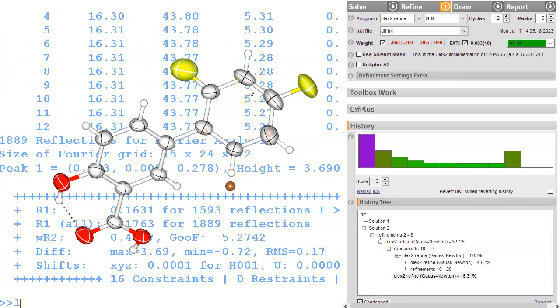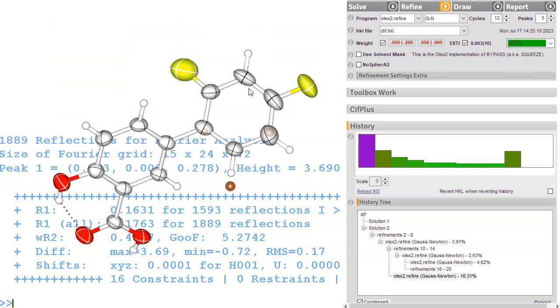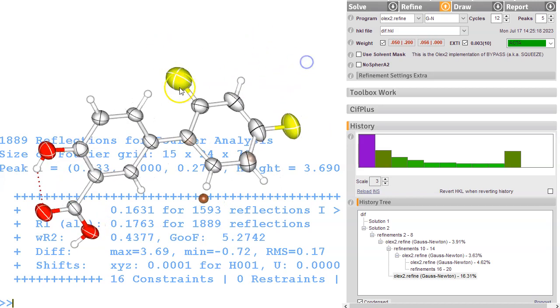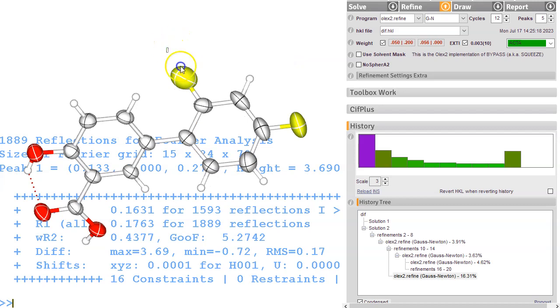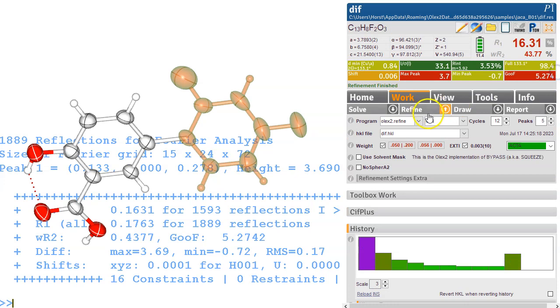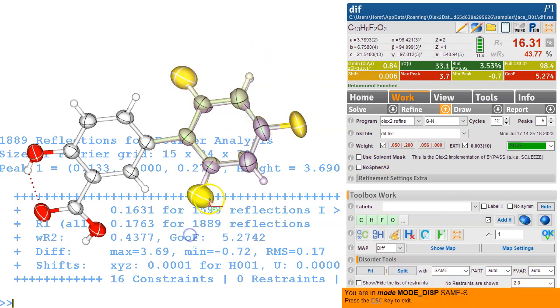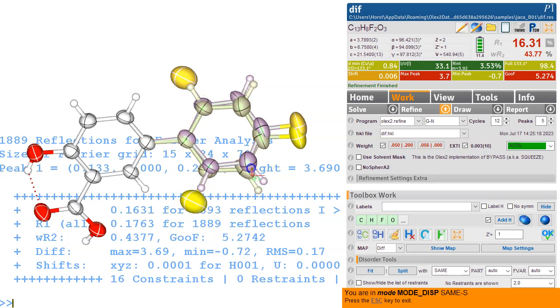Now we've got too many lines. Lines 12, so we're hiding some of those lines again. Right, so what we can do, rather than modeling this separately, is actually use the whole thing. We can select the whole entity we'd like to have modeled as disordered, go over to the toolbox work and down into the disorder tools, and we can just use the split tool with all of these defaults, and now we can just pull the whole thing over. So we're pulling it over into a second position.